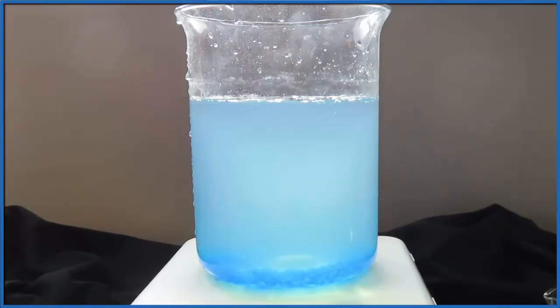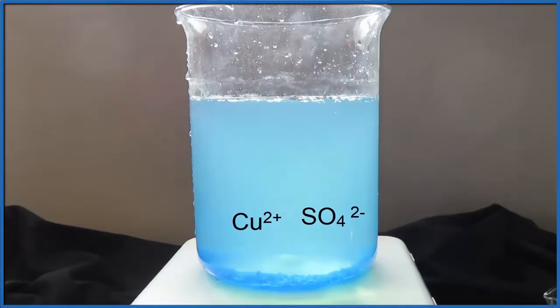And that's going to break the copper-2-sulfate, that blue crystal, apart into Cu2+. That's the copper ion. That's what makes it blue. And SO4-2-, the sulfate ion.